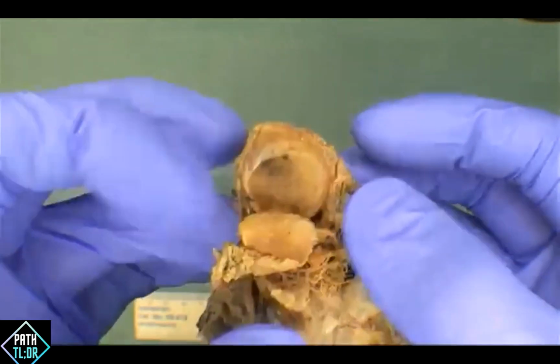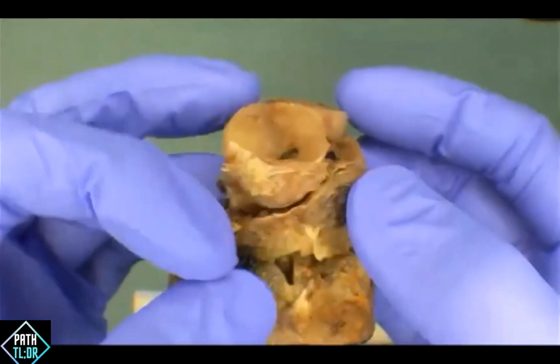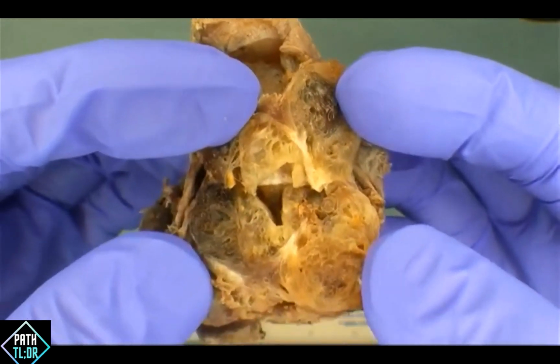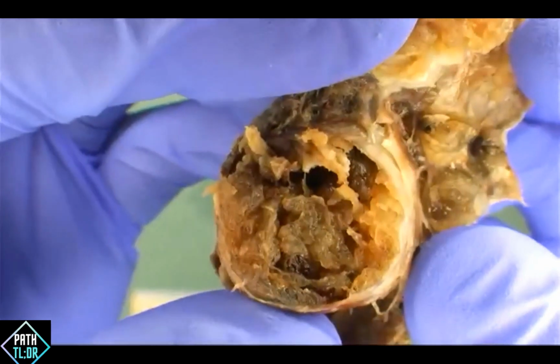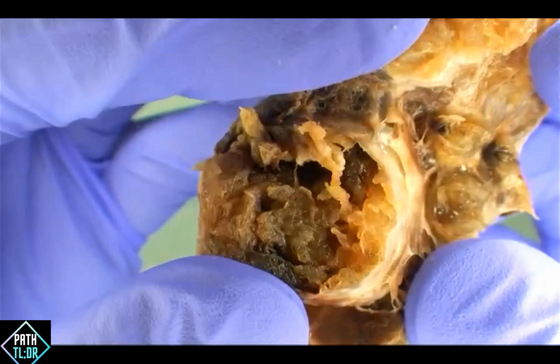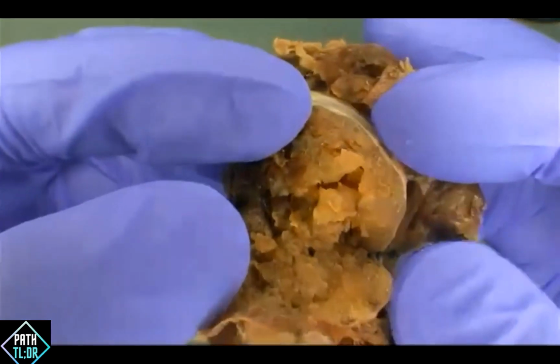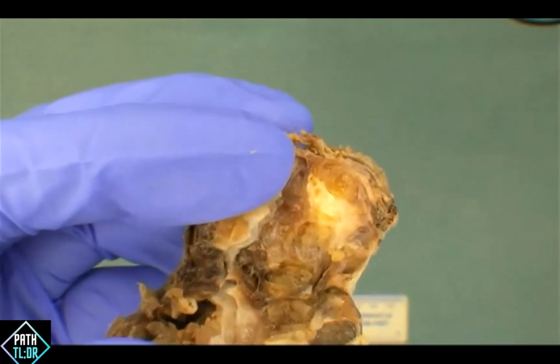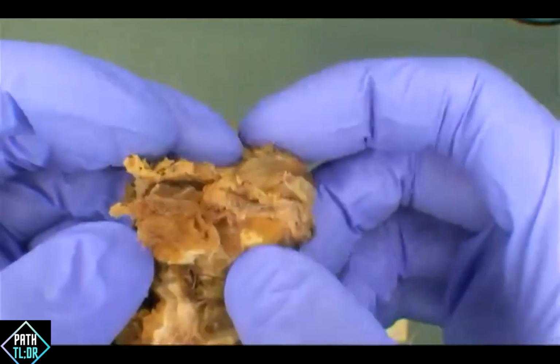We'll do a quick tour again. Yeah, there's some areas that look a little bit more kind of papillary, although I think it's just probably the nature of some of these nodules here. How about some pertinent negatives, folks? What are you not seeing? Might be worthwhile to mention. Hemorrhage, overt necrosis, those are good. Calcifications. Yeah. Of course, you're going to point it out. So there is calcifications, my bad. There is definitely some calcification here.